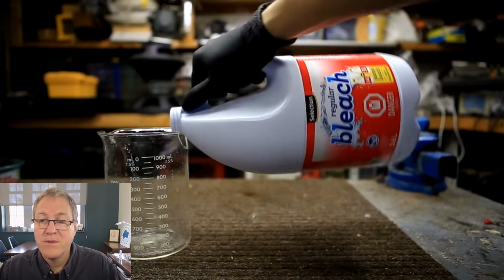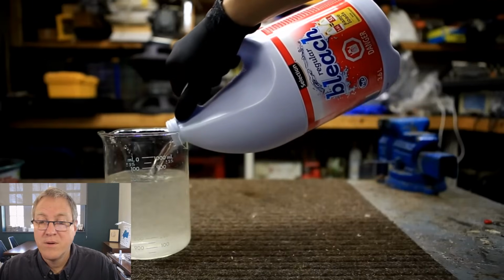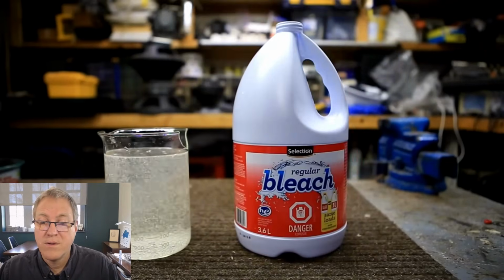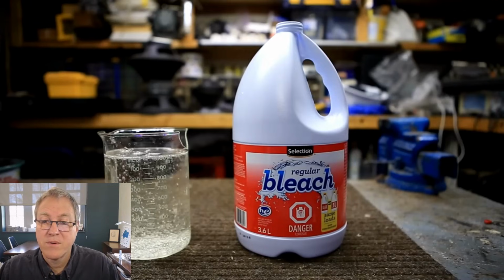Eventually, the remaining liquid of the bleach bottle is poured into the beaker, and the chloroform layer is allowed to settle on the bottom. You might notice that the solution is much less yellow than the previous example that I showed. This is because it was allowed to react overnight, and the concentration of sodium hypochlorite in the solution is much less.